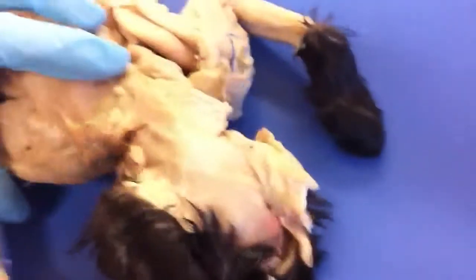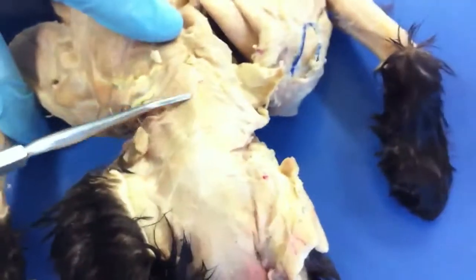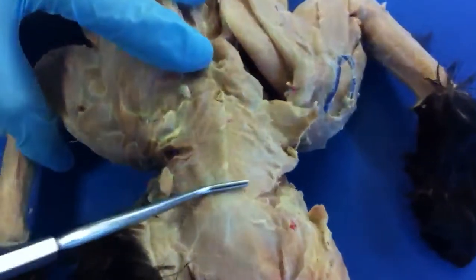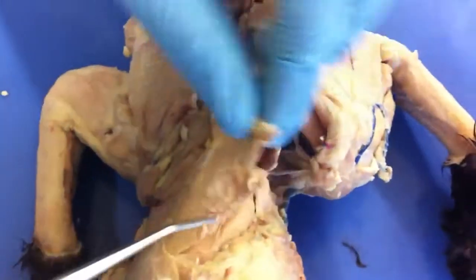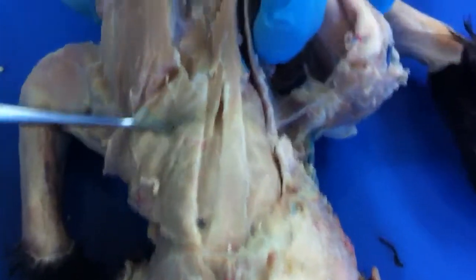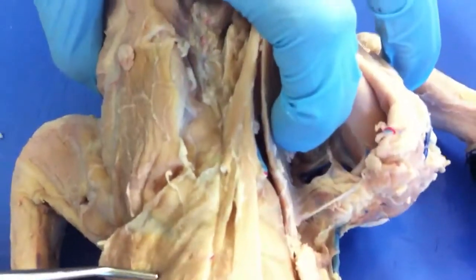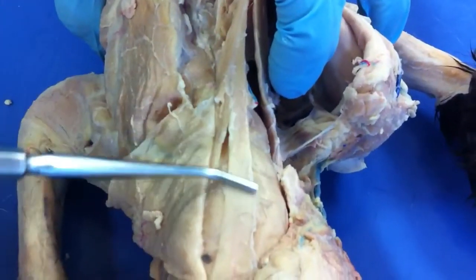The temporalis is up here. Clavotrapezius will be the very first superficial neck muscle, and we actually reflected it — if you want to pull the flap up, it's that one right there. Then underneath there, you can kind of see the rhomboideus capitis, which is one of the main parts. You can see where it inserts into the superior spine of the scapula, and that's the rest of the rhomboideus.